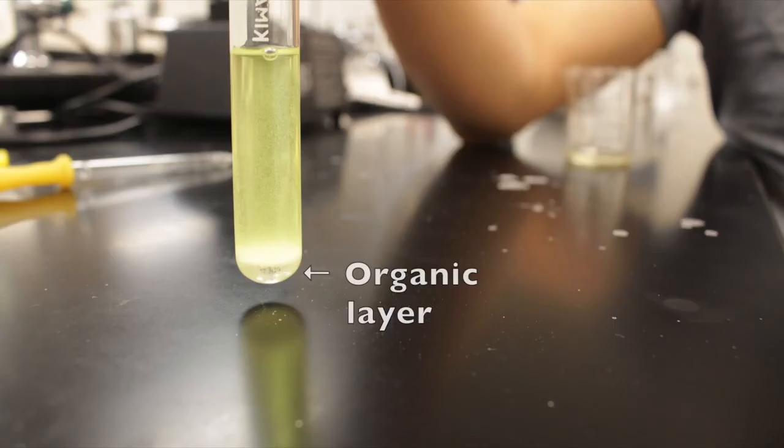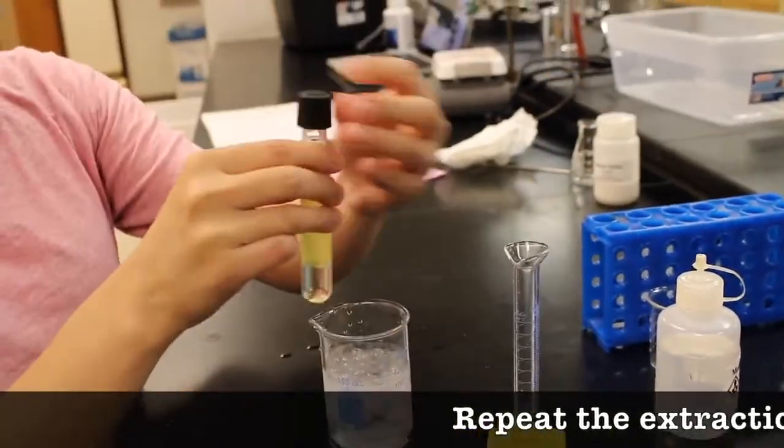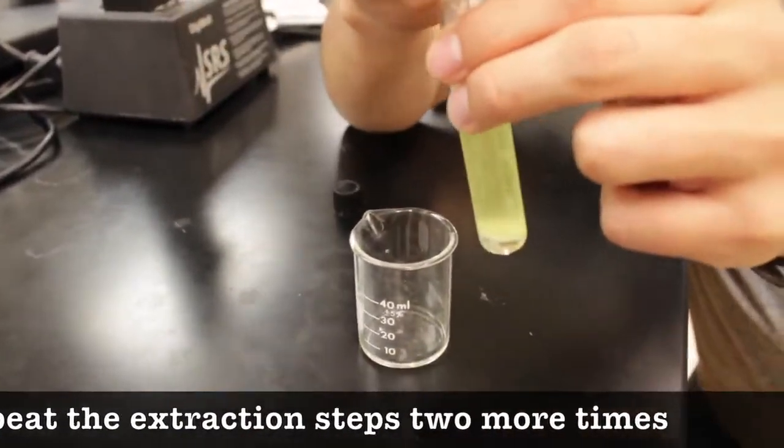Also, try to leave some organic layer at the bottom of the test tube so you don't draw a lot of the aqueous solution along with it. Repeat the extraction steps 2 more times.